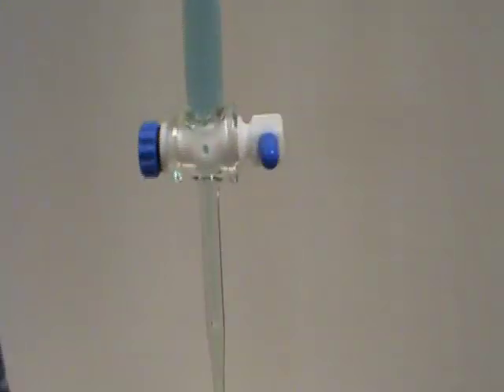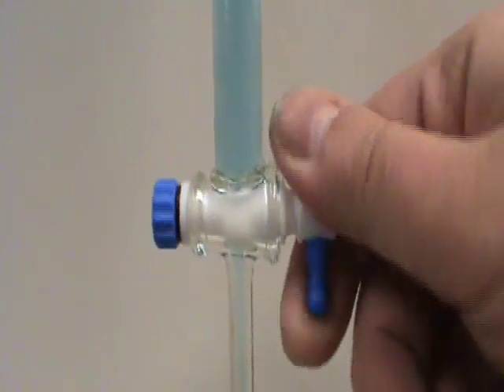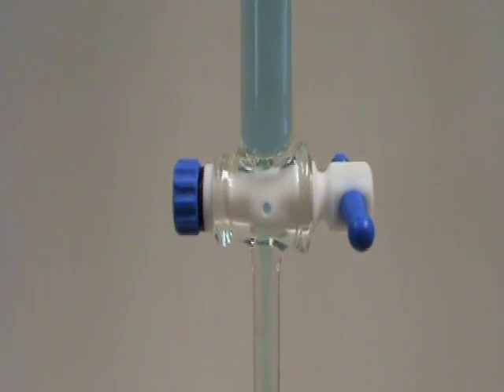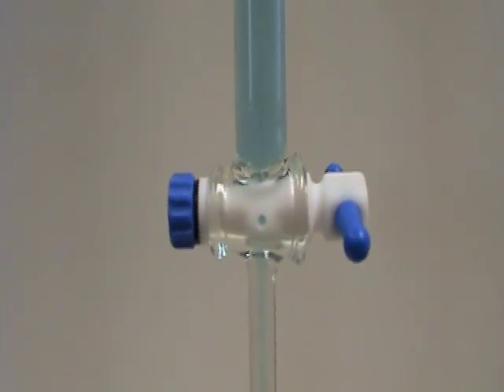And that was pretty simple, it didn't take much time at all, although you see I do still have one little bubble in there, so let's go a little farther. Now I've got a jet tip that's full — you can even see the hole through the stopcock as it's looking out the side.